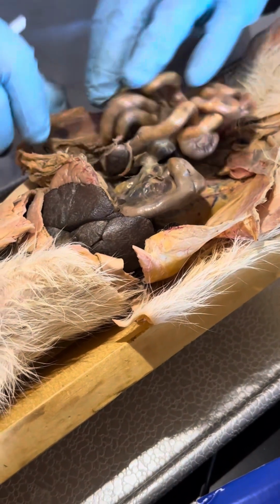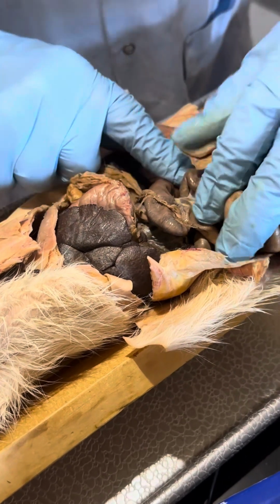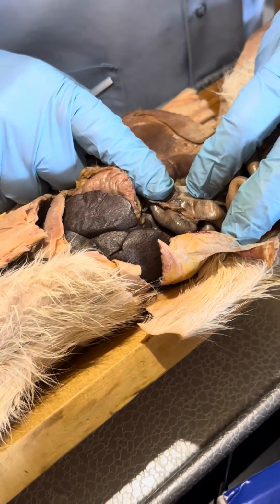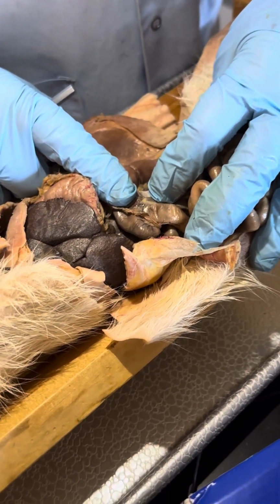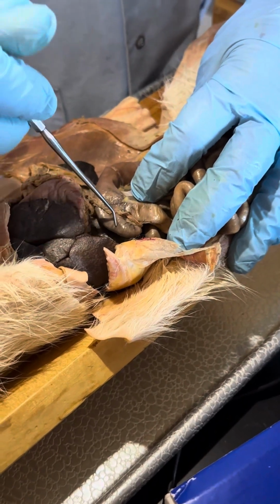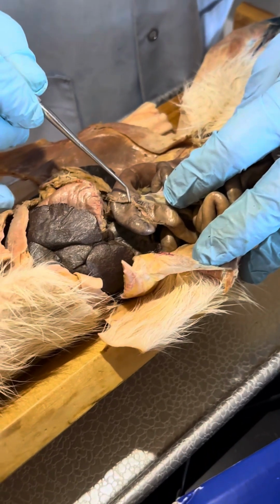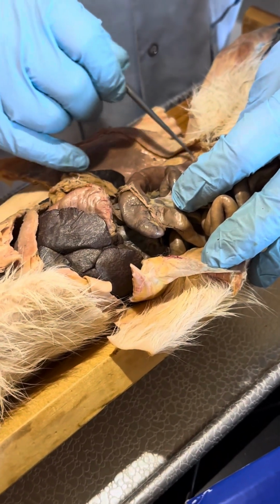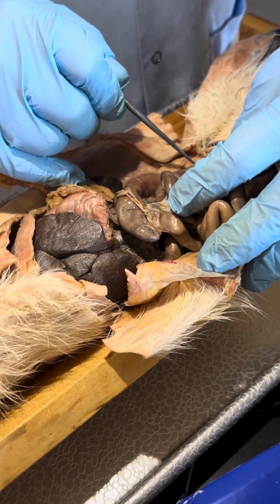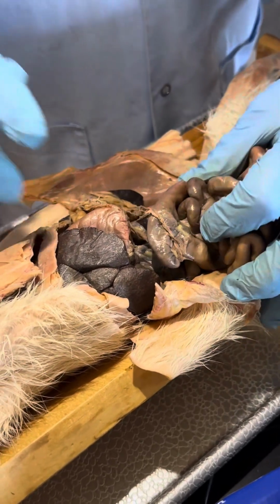We have the large intestine. The large intestine in a cat has a higher percentage of it that is the colon than in a human, because there isn't really an ascending colon. There is a cecum. The cecum is really small. And then the anatomical conundrum of the cat is, if it looks like a question mark, why do we call it a colon? I don't have an answer for that, but I'm sure someone will come up with it. It's probably Leah.